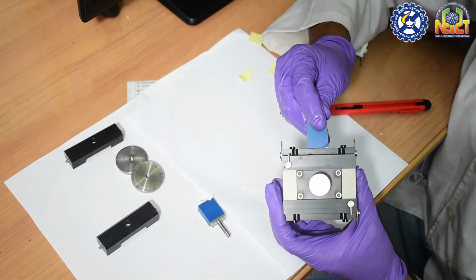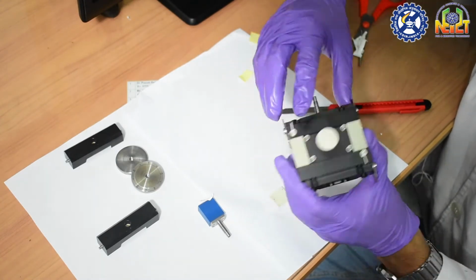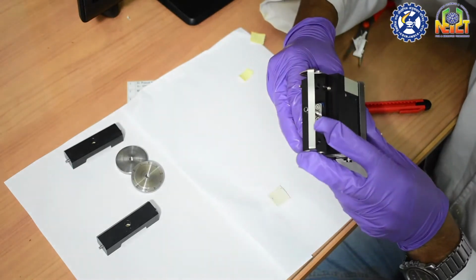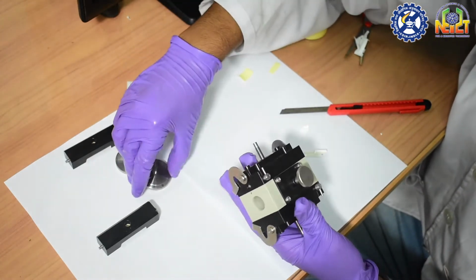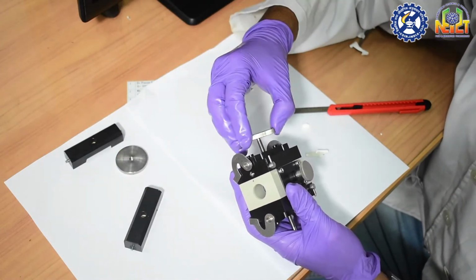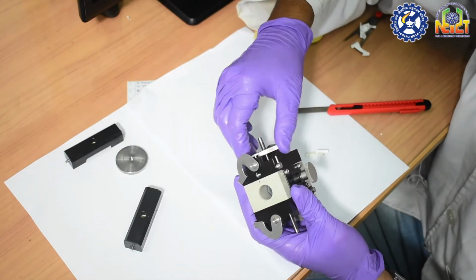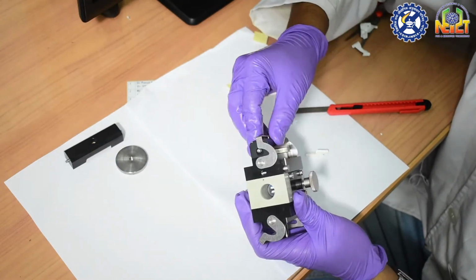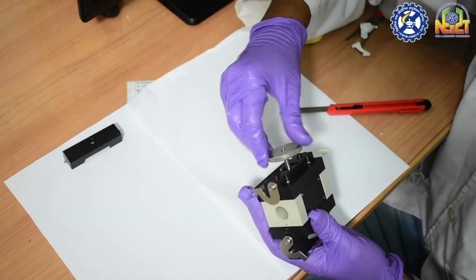After mounting the samples on the sample holders, we have to insert the sample holders with the samples into the rectangular holes of the housing of the adjustable gap cell. Now we have to mount the knurled nuts with the scale on the threads of the sample holders, and then mount the counter pieces of the knurled nuts and fix the counter pieces with the clamps.